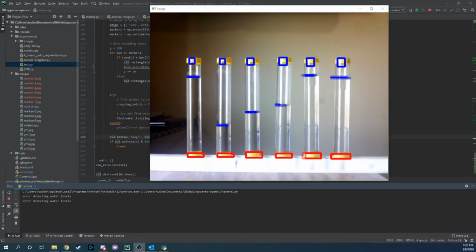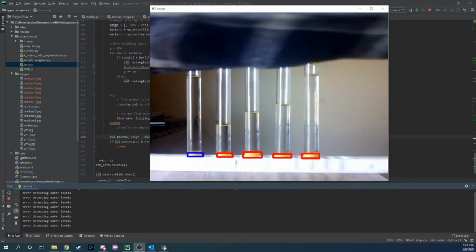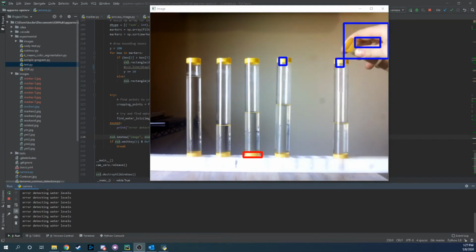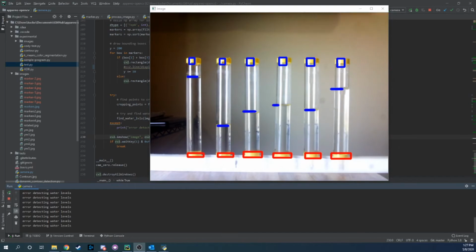So this is a final working example. You can see the blue boxes are what we detect as a marker on the top, and the red are the ones we detect as markers on the bottom. Then in between, we look for the water level, and that is represented as the blue line. And you can see it is actually quite dynamic, where I'll remove a little water and it can detect it, and then I can remove water and add water, and it'll detect it again.